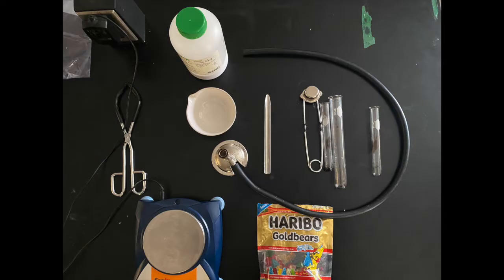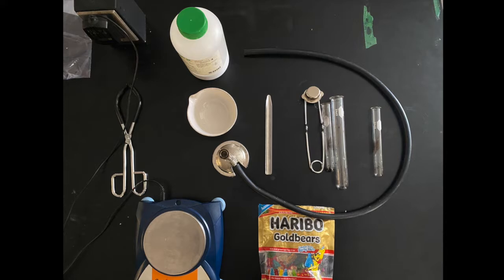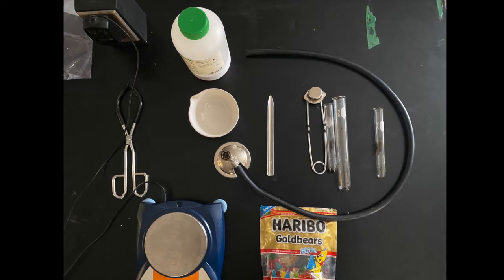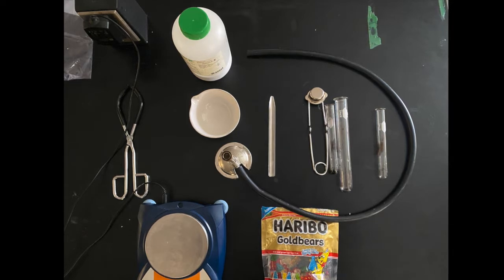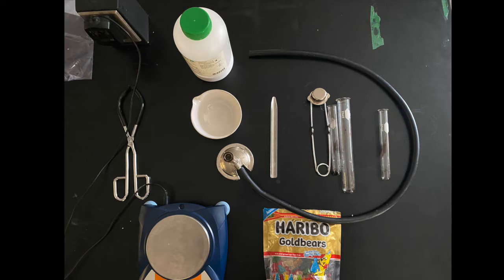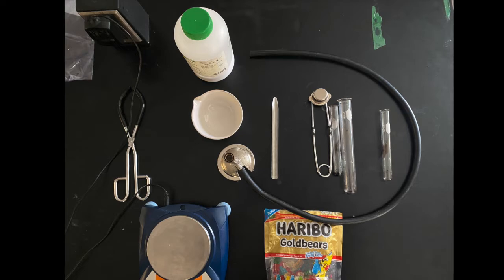An oxidation reduction reaction, aka a redox reaction, is any chemical reaction in which an oxidation number of the species that are going through that chemical reaction change. And so in terms of our gummy bear experiment, the gummy bear is mostly sugar, sucrose, which we know is easily oxidized by something like potassium chlorate in a molten or liquid form. And that's what creates that combustion reaction that we see happen.